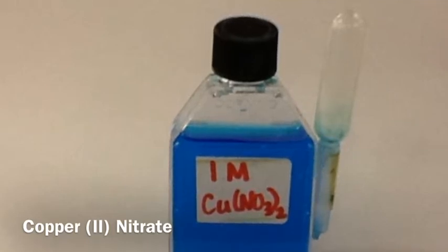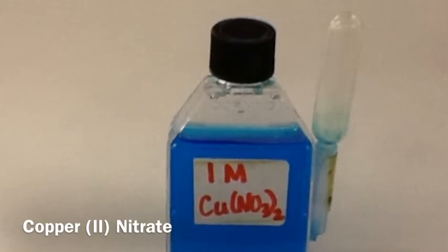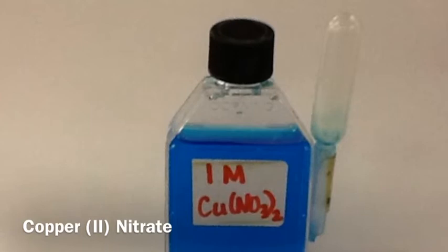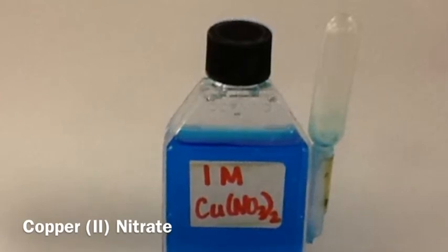First, the color, and in this particular series of reactions, you're going to have a couple of blues, so be descriptive when you're writing the blue. Robin egg blue, sky blue, aqua blue, so forth.